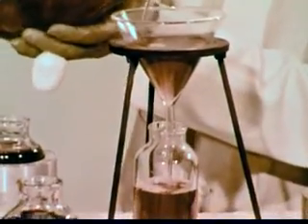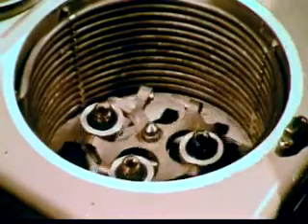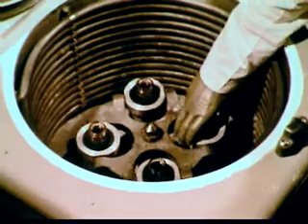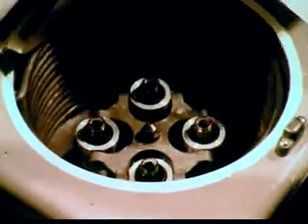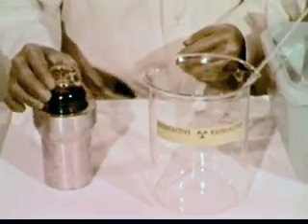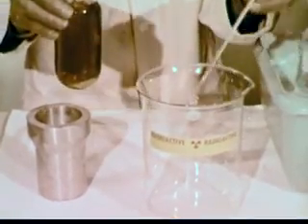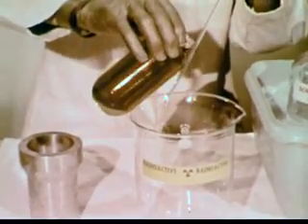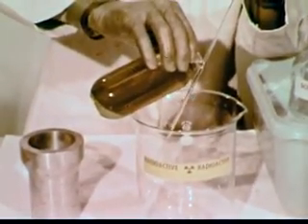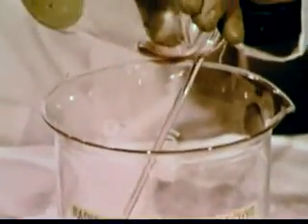The cancer cell suspension is poured into large cups to be spun in a centrifuge. The spinning collects the suspended cancer cells into a pellet on the bottom of the cup. The liquid is discarded. By this means, the cells from large volumes of the culture medium are finally concentrated into one cup.